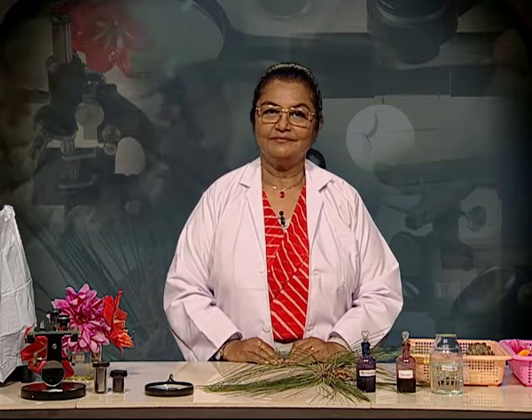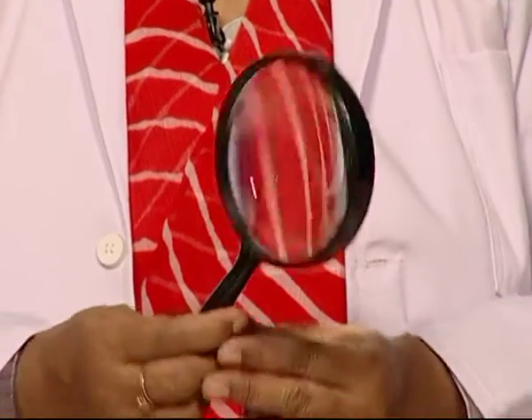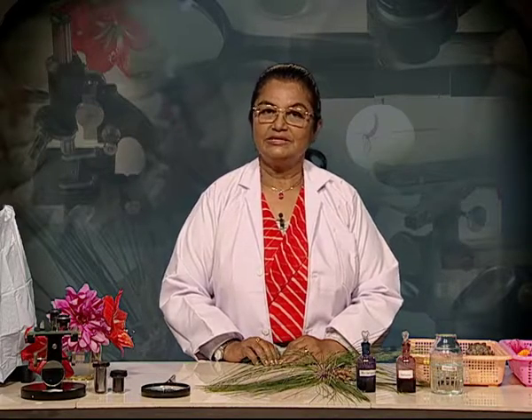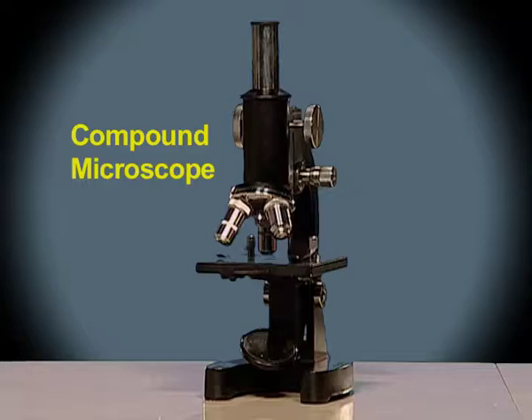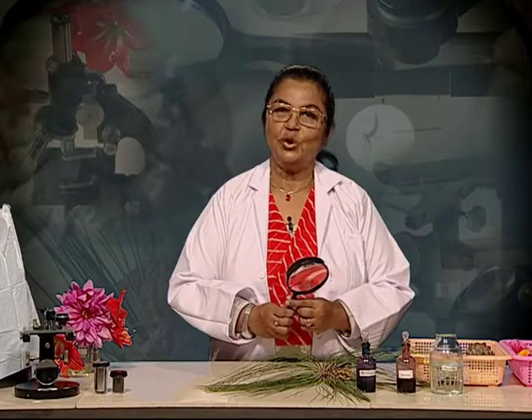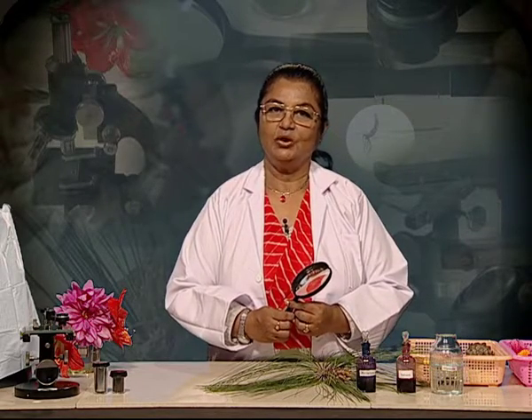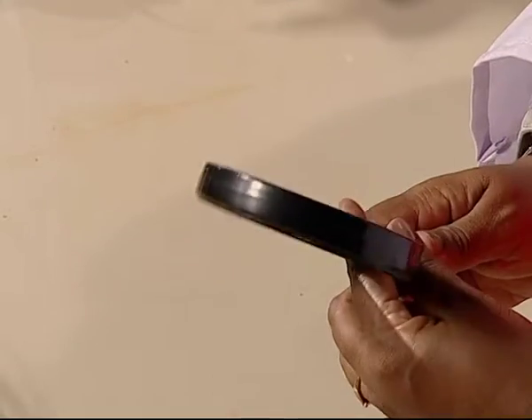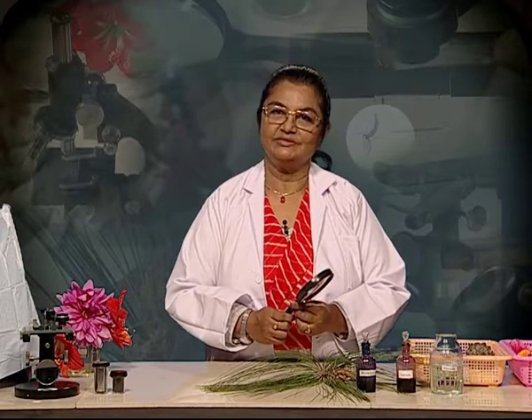The first one, the hand lens. The second type is the simple microscope or the dissection microscope, and the third type is the compound microscope. A hand lens is a convex lens that is used to produce a magnified image of an object. It has low magnifying power. It can magnify objects only from 2 to 6 times.